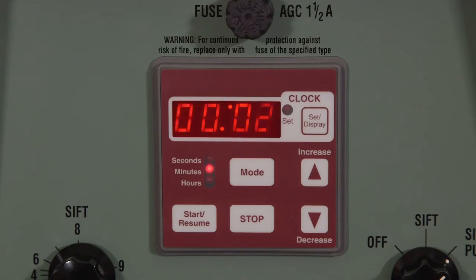Once the countdown reaches zero, the L3P will stop and the timer will beep indicating your test is complete.